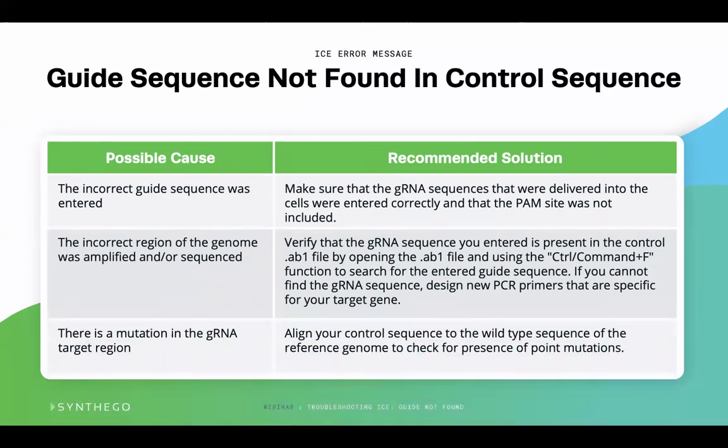The last common possible cause is a mutation in the guide RNA target region. This is caused by natural variations such as single nucleotide variants, referred to as SNVs, or single nucleotide polymorphisms, referred to as SNPs, which are very common. Therefore, you need to align your wild-type sequence with the reference genome to identify any possible natural variants in the targeted region. If there are no SNV or SNPs present, your wild type and reference genome should align. If there are SNV or SNPs present in your wild type sequence, you will need to consider changing your guide design to include these variants.